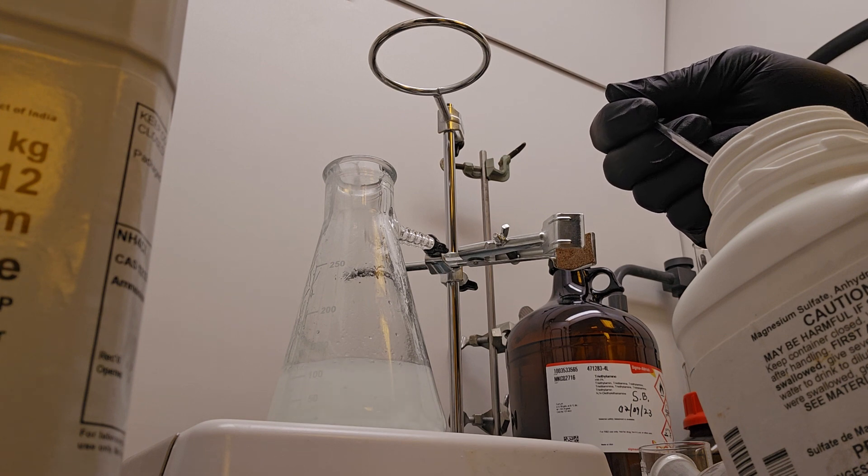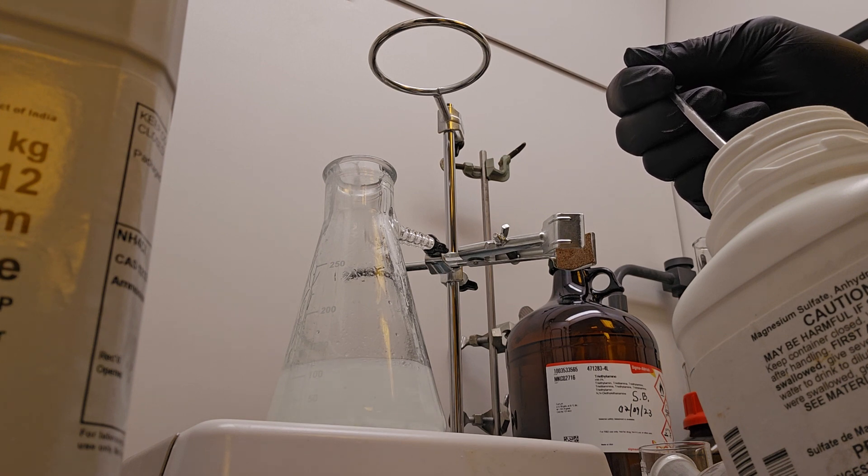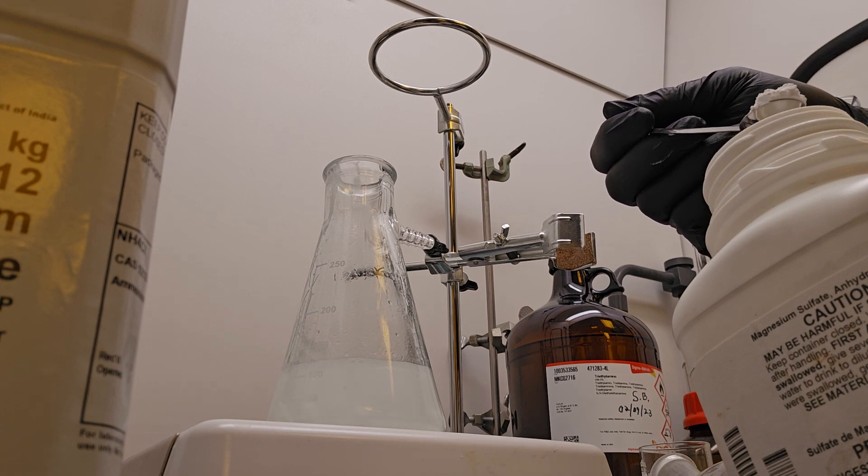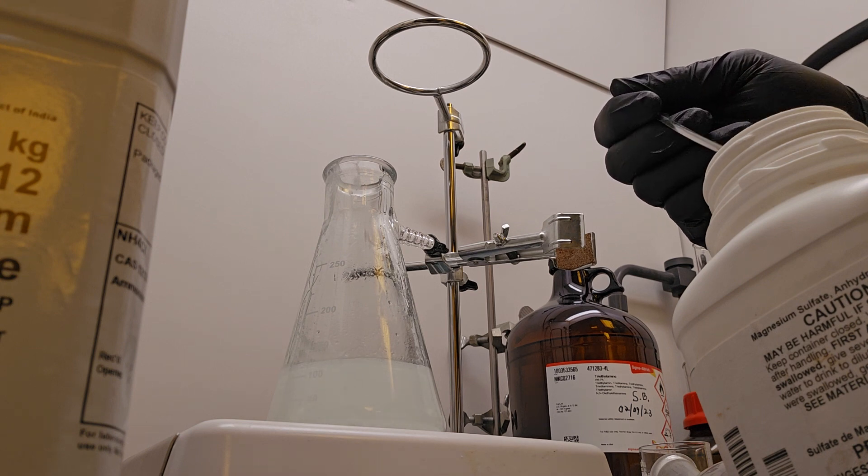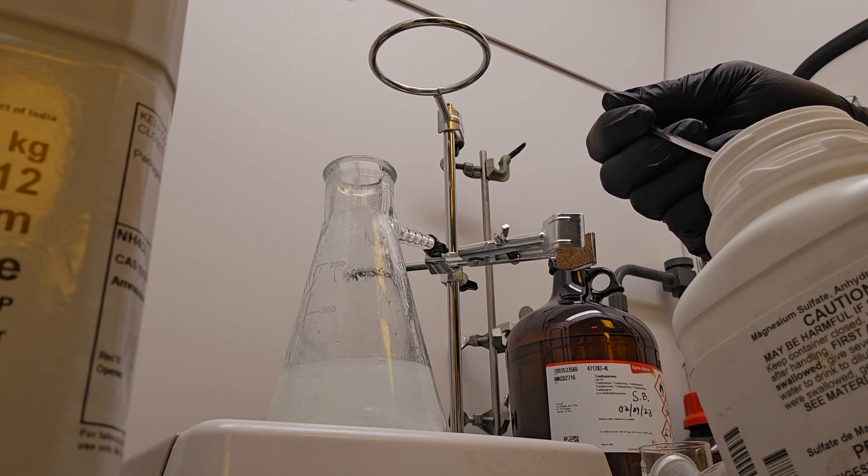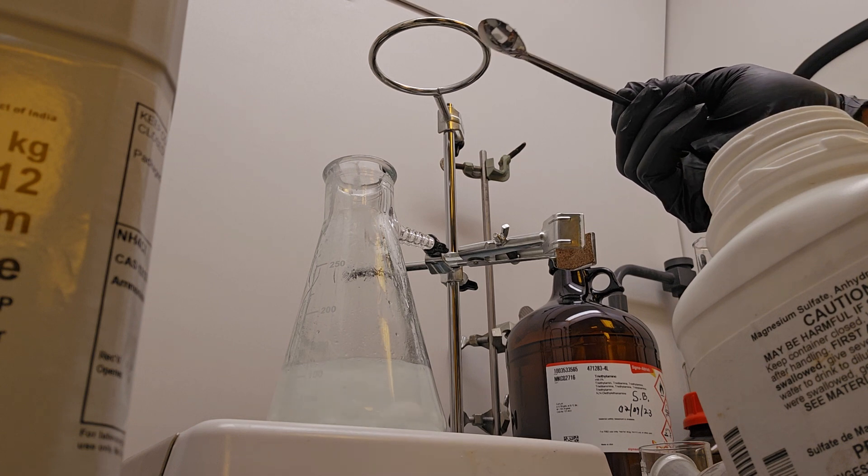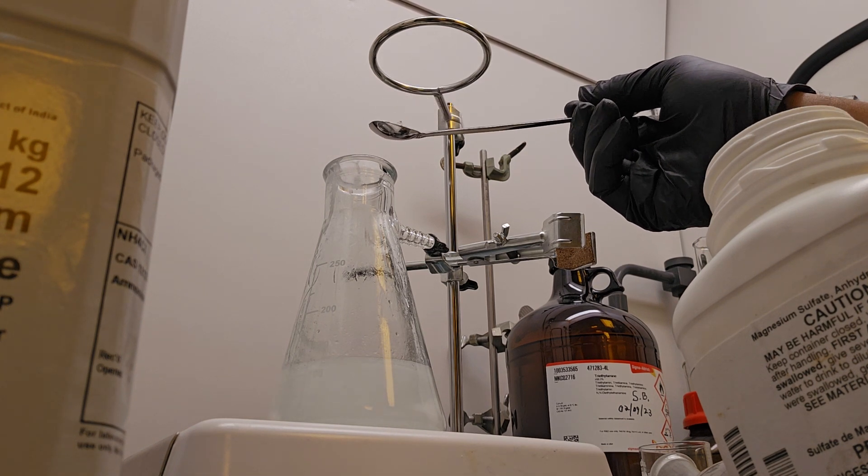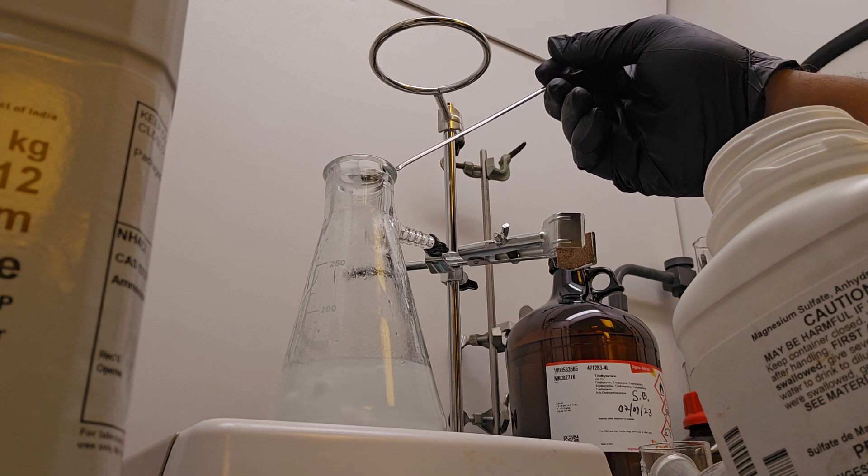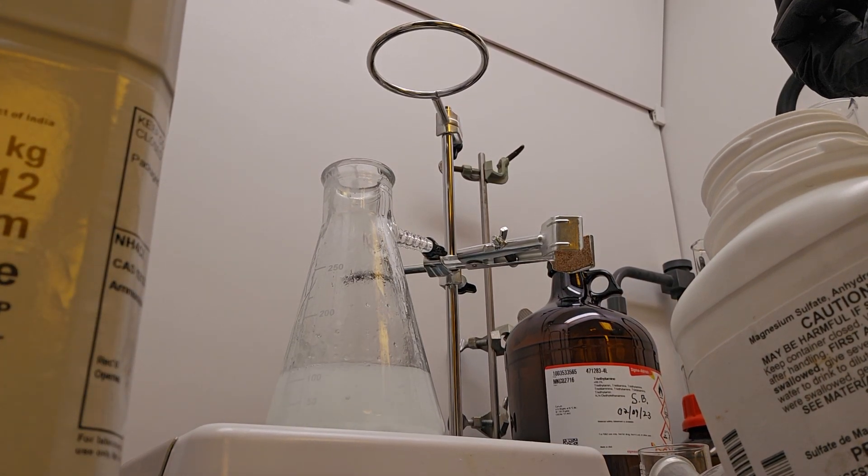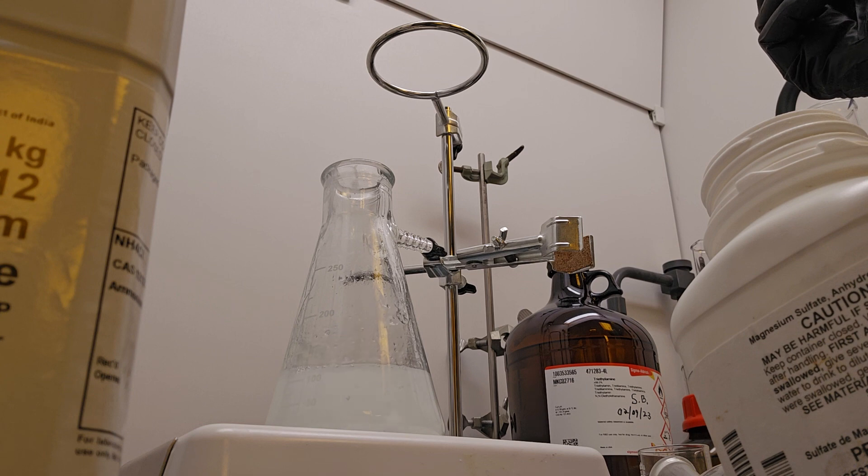Very easy. You can see the magnesium sulfate beginning to clump up. And that is a sign that it has grabbed all the water. But I'm going to drop, just to be safe, another eighth of a teaspoon of magnesium sulfate in there.